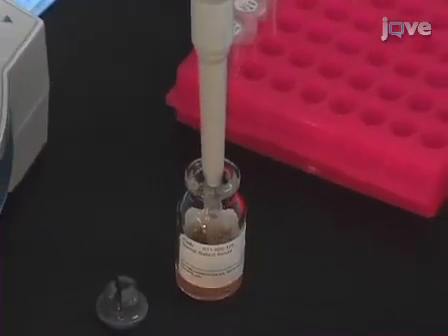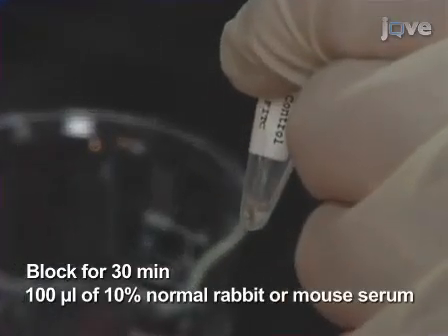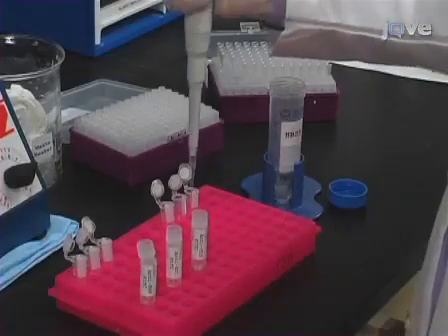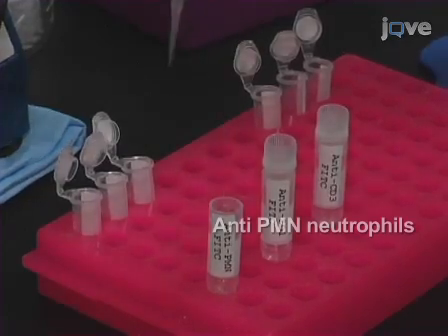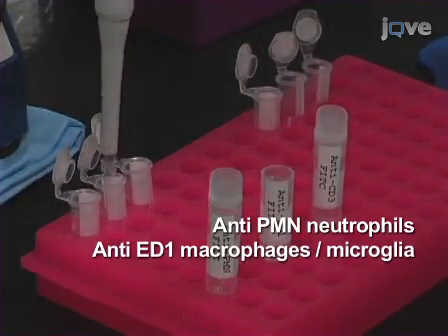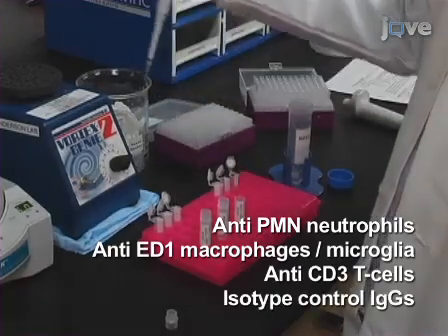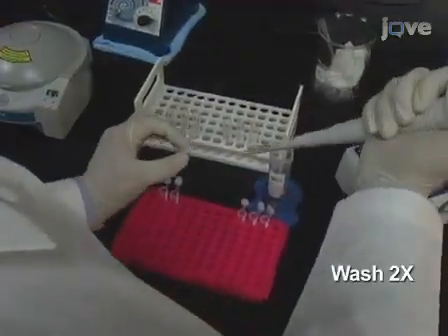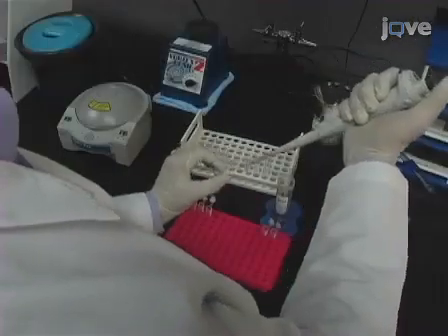Cells are blocked for non-specific antibody binding for 30 minutes with 100 microliters of 10% normal rabbit or mouse serum. Wash the cells again. Then incubate the cells with fluorescent FITC antibodies against PMN neutrophils, ED1 macrophages and microglia, CD3 T cells, or isotype control IgGs diluted in HBSS for 1 hour. Then wash the cells 2 more times and resuspend the pellet in 300 microliters of HBSS and transfer to FACS tubes.